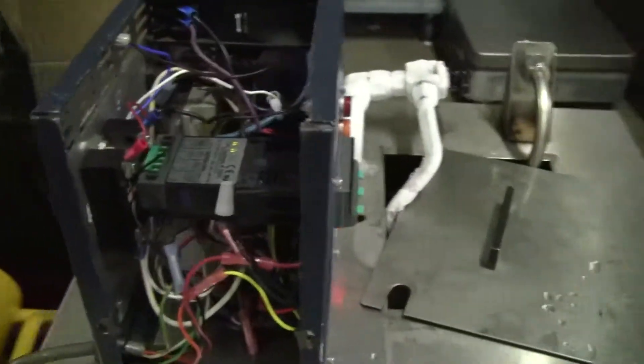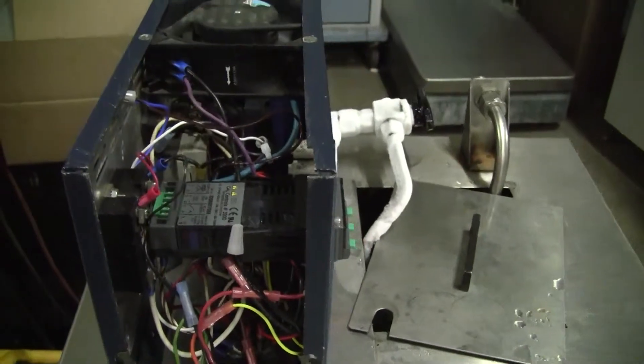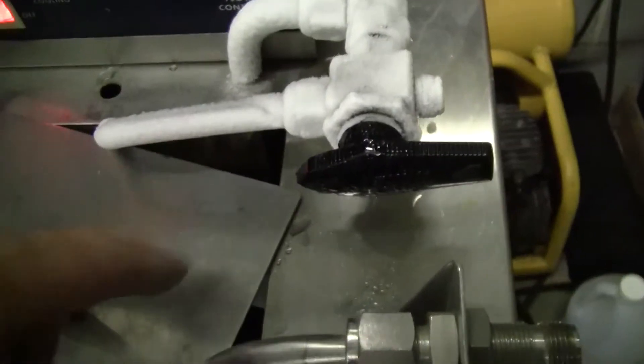We modified the control panel, putting in a cal controller, solid state relay — simplistic. As you can see, we're certainly icing up the stainless steel line. We are getting good flow.